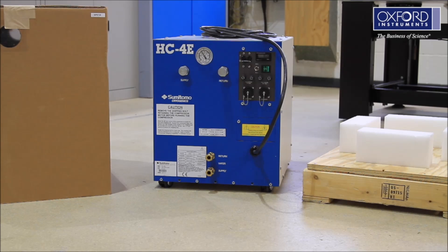There are two different types of compressor, air-cooled and water-cooled. This video focuses on the water-cooled version. The manual for the compressor is in box 2. You must read the manual and other relevant material. You must understand all of the health and safety information before you start to unpack the compressor.